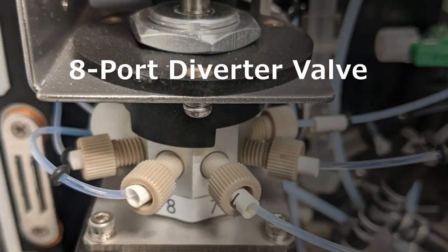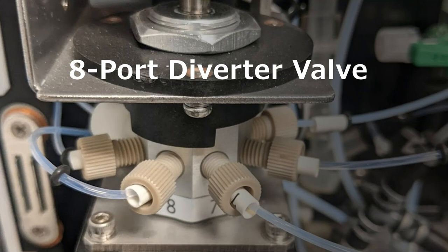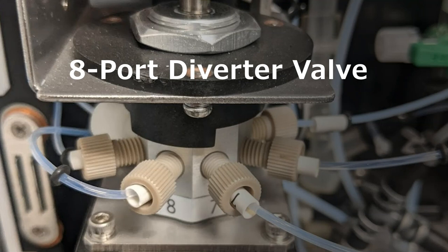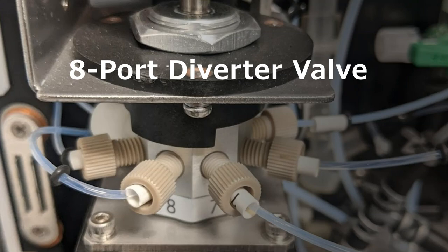The eight-port diverter valve is one of the most important pieces of the instrument. It collects all the influents — our sample, our diluent, our acid, and our IC reagent — to our combustion chamber and our IC vessel. This valve switching positions is what controls the direction of flow in the instrument. It's also arguably one of the easiest pieces of equipment to break because it gets corroded if there's any acid leaks and it has a lot of moving parts.